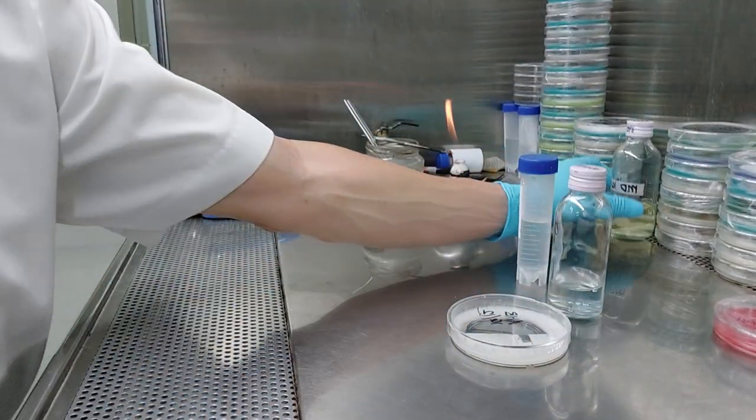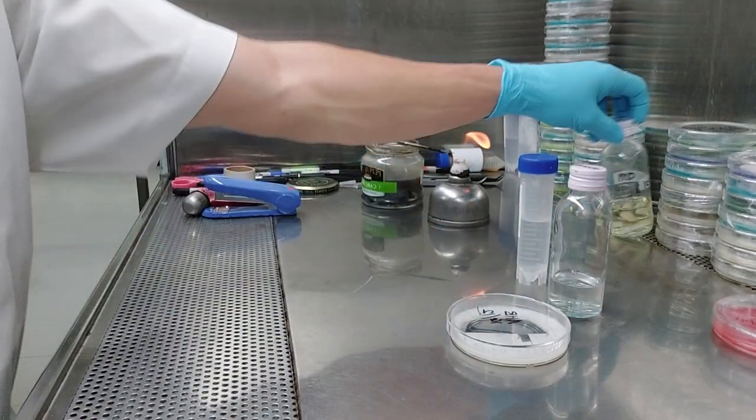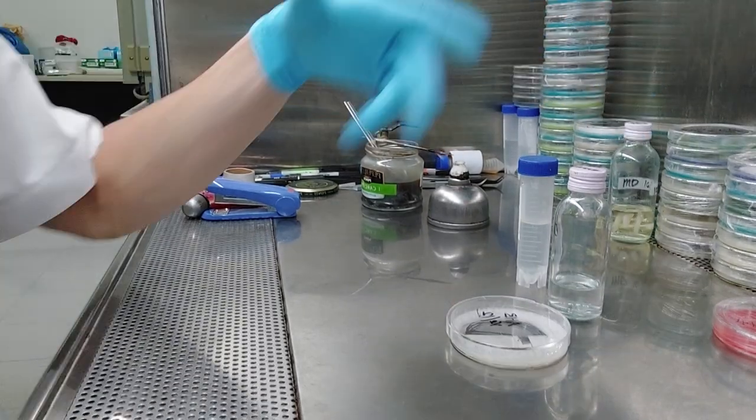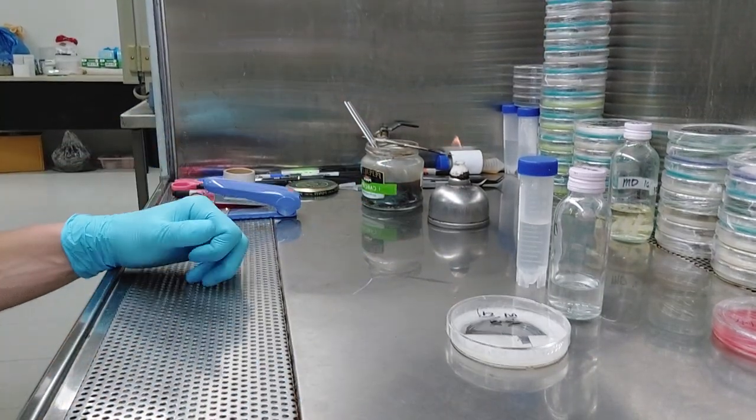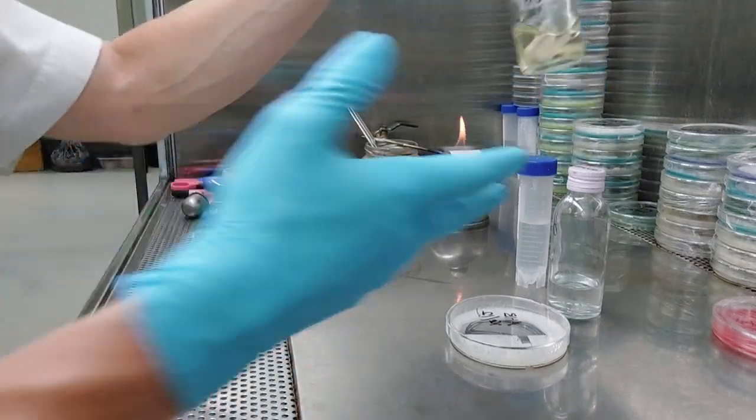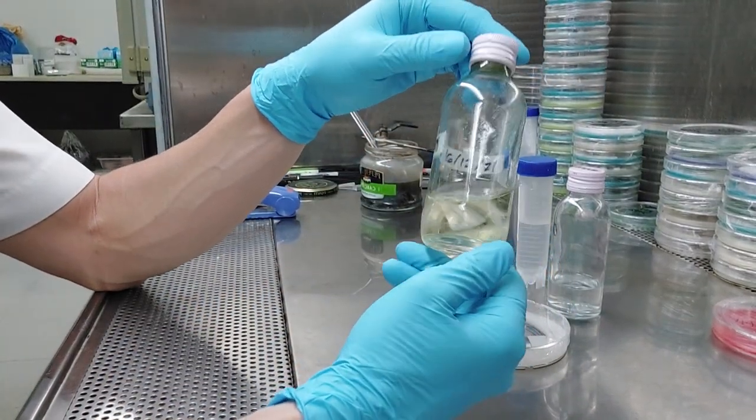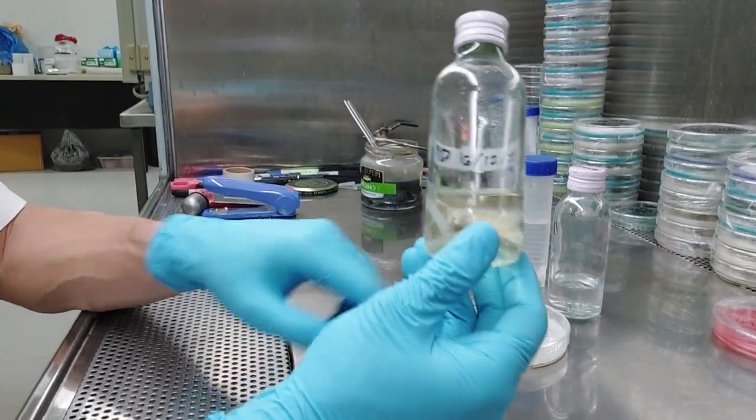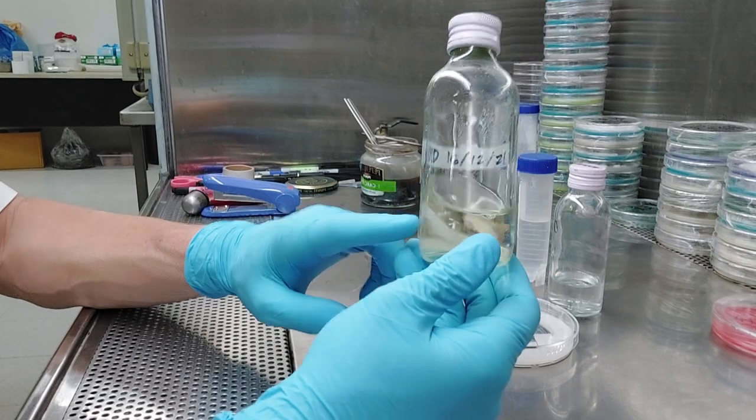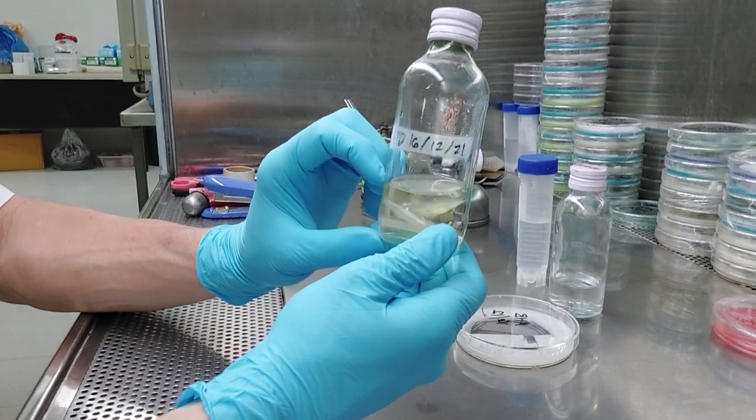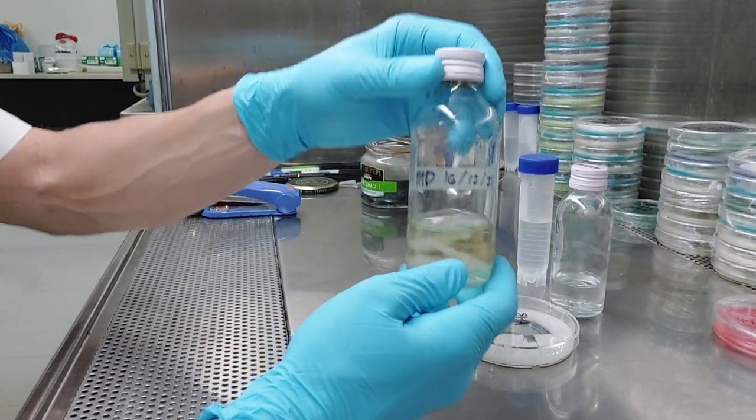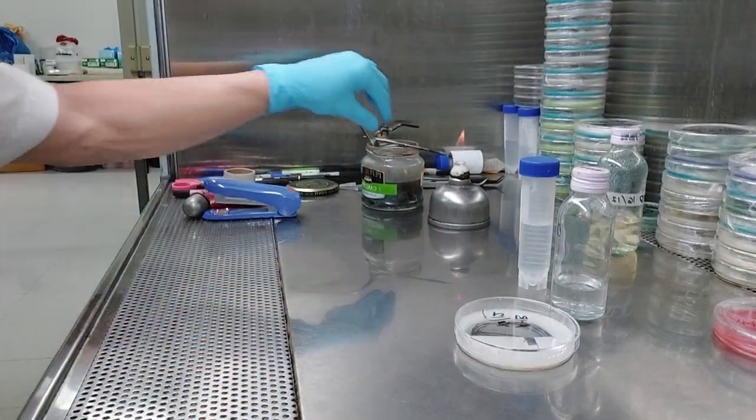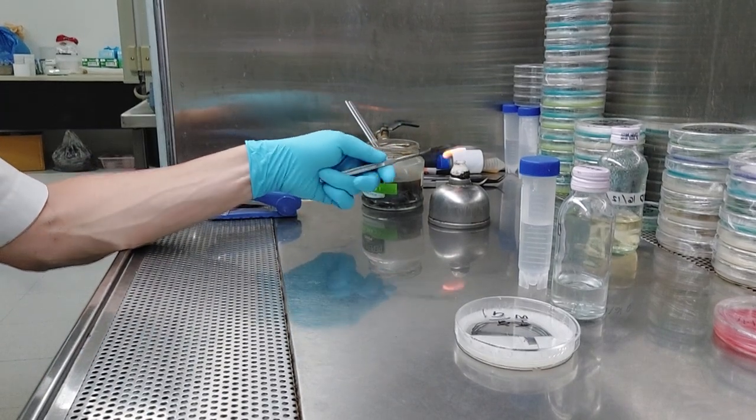Two options here. Let me get that old one out of the way. That guy's done. So notice how the water has kind of gotten a little bit yellow. That's because the agar that I use, it's still MEA, PDA. I'm using a slightly different version now, but it doesn't matter. I think some people will say go to water agar before you put them in long-term storage. I don't think it's really necessary. I mean, if you put the volume there, I'm going to put three or four strips of this agar media in this, like, that's about 50 cc's of water. It's going to get diluted, and it just, like, obviously it works. Like I said, that's over two years old, and it worked perfectly fine. I've pulled cultures out that have been five or six years old.